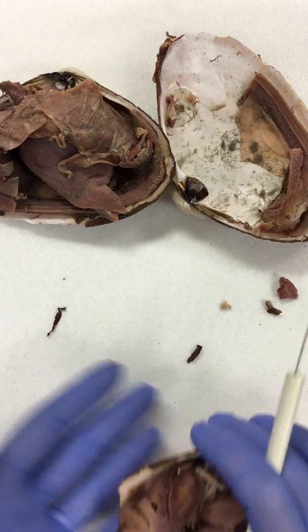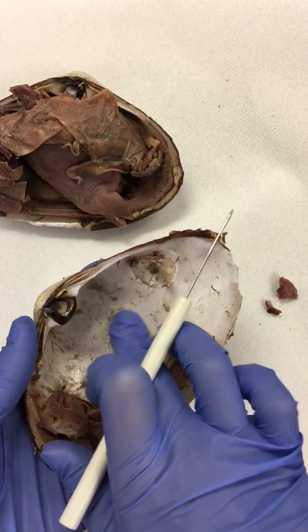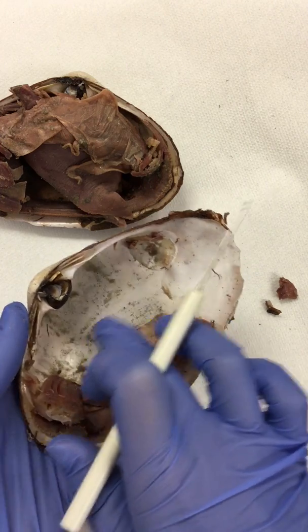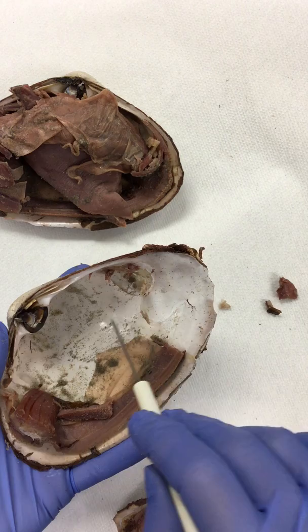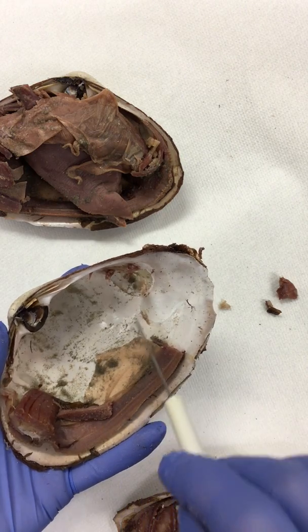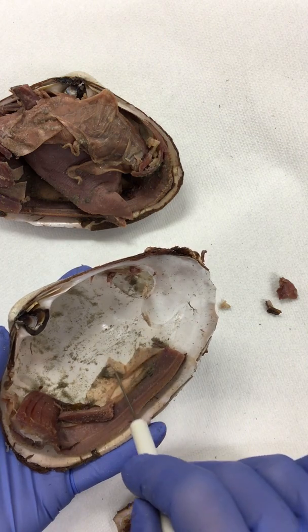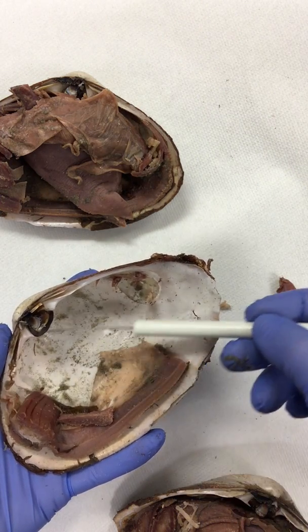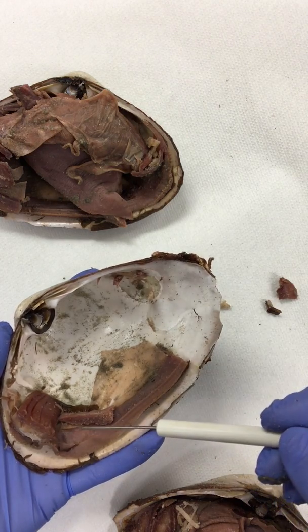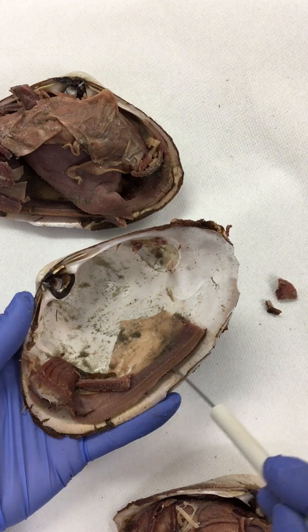What we're going to look at here is a couple of things. There's lots of sand particles inside of this clam, and it is covering up the shiny region, which is the mother of pearl. That mother of pearl is actually secreted by this stuff right here, which is the mantle. This is that tissue. These are bilaterally symmetrical, so what you see on this side is what you're going to see on the other valve or shell. This is the mantle edge or mantle skirt.